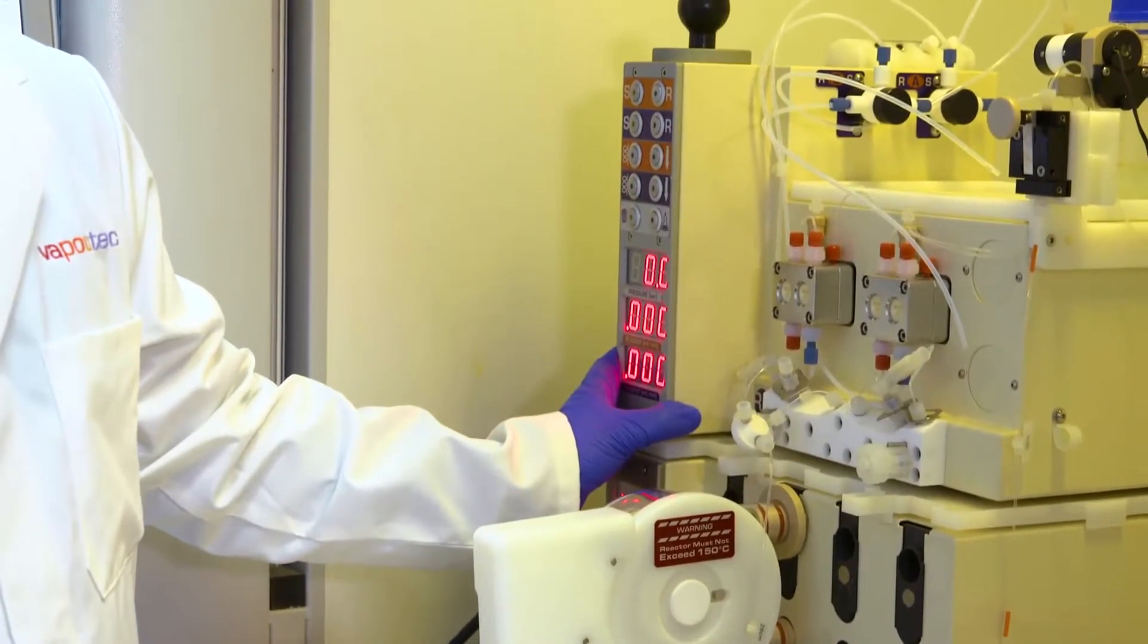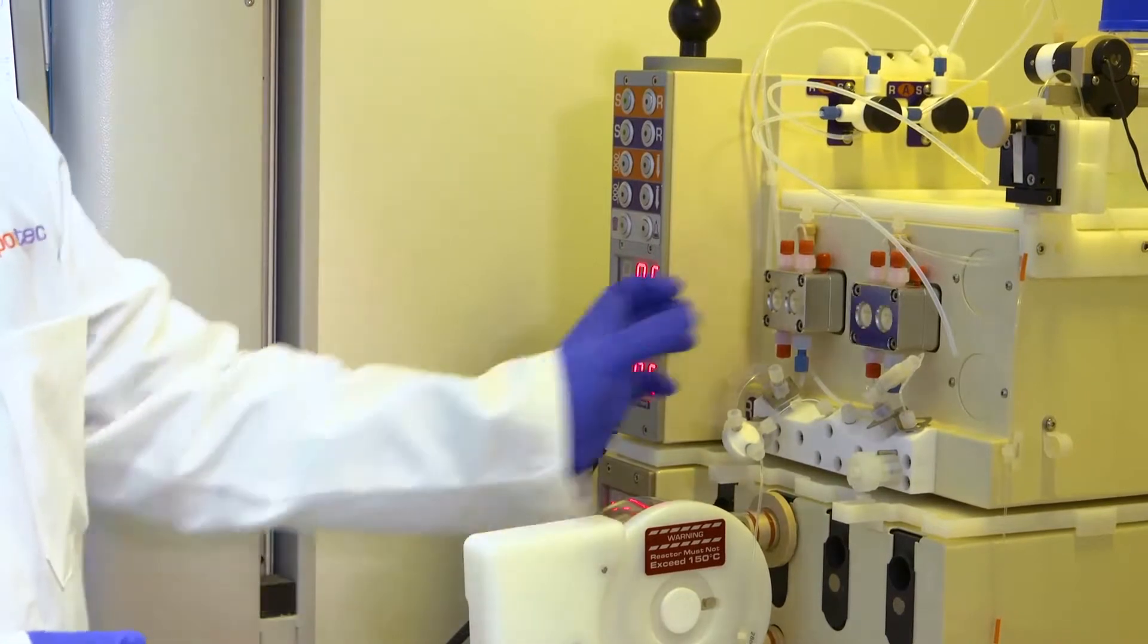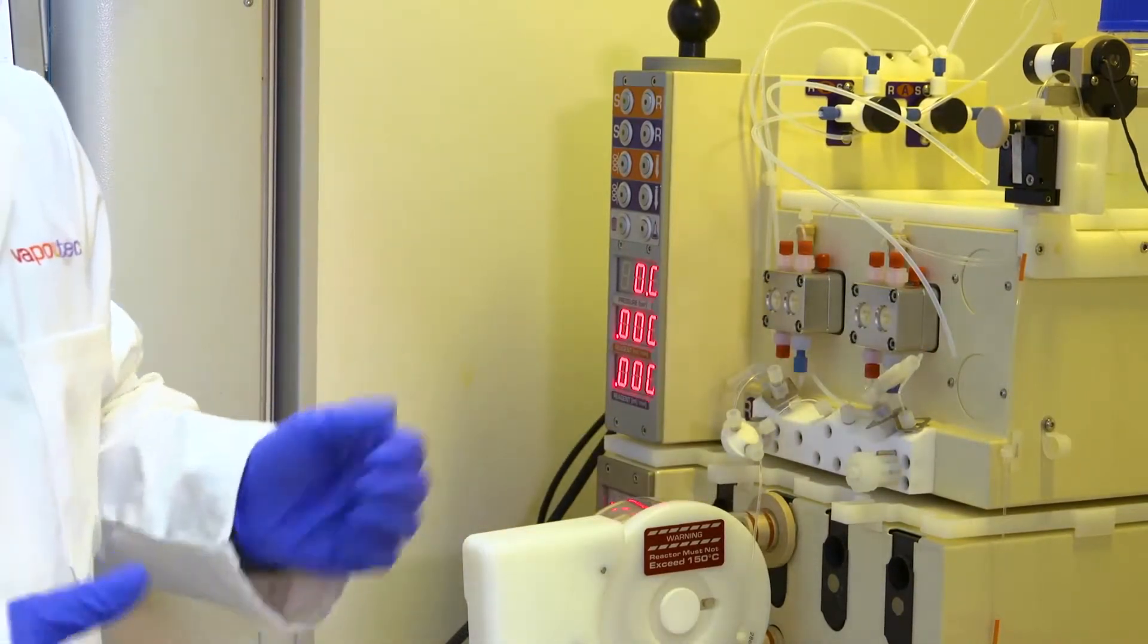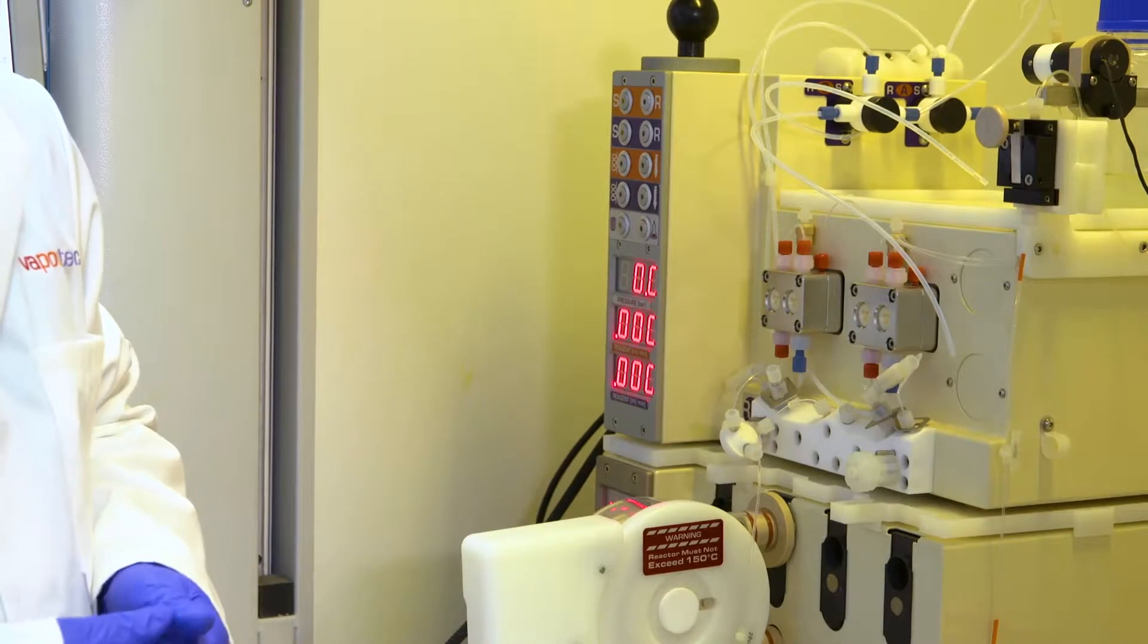Because of that I'm using the R2HFC. This is a high flow rate pump head with two 50 milliliter pumps with the same chemical compatibility as our other acid resistant systems.